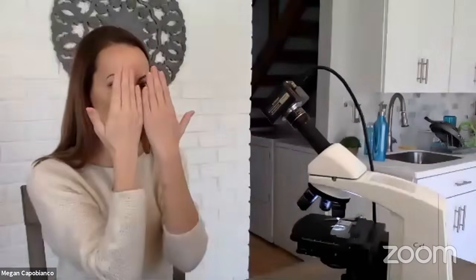Okay, I'm going to turn on the light. All right, I always start on the smallest lens. That's the most zoomed out. I always think about if I were to have a paper with a whole bunch of words on it, would I want to start looking for one specific word with it back here or right up against my face? It's going to be easier to start further away and then bring it closer.